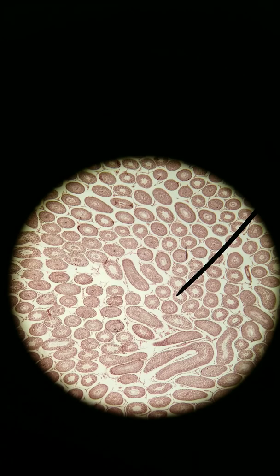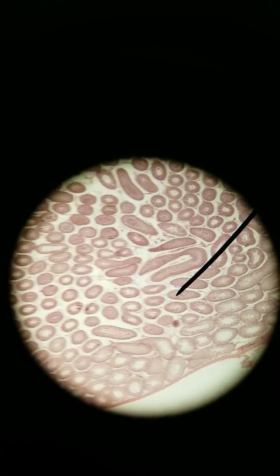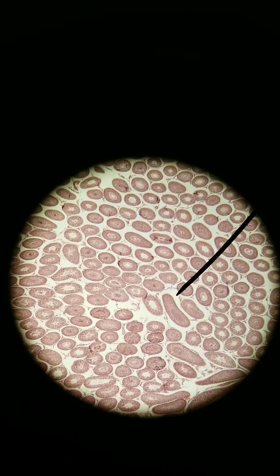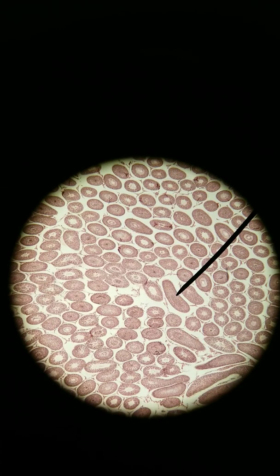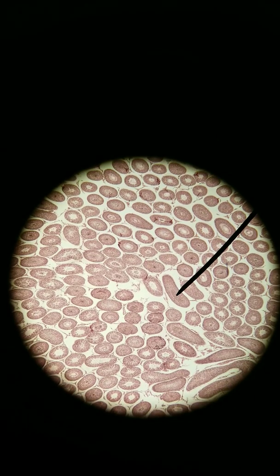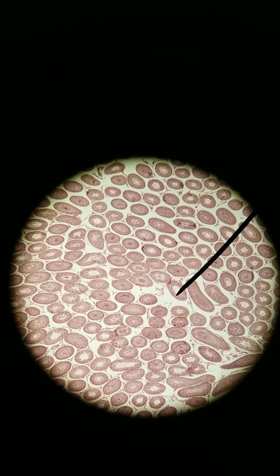So first, how do we know we're looking at the testes? We see a bunch of these round things. Those are tubes, and they're all encased. So these tubes are seminiferous tubules. They produce semen and sperm. So at the very center of these tubes, that's where the produced sperm are made and sent away from the testes. But we'll get into all that later.